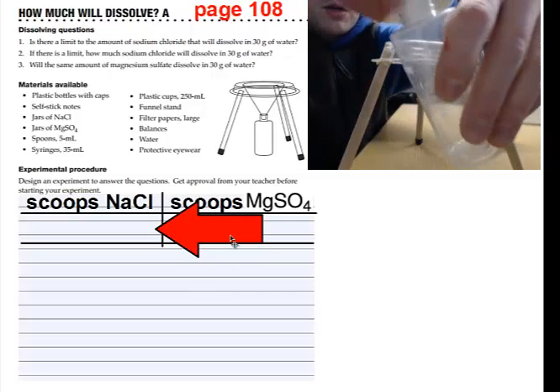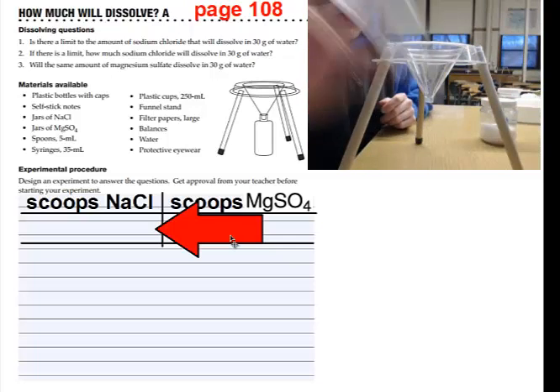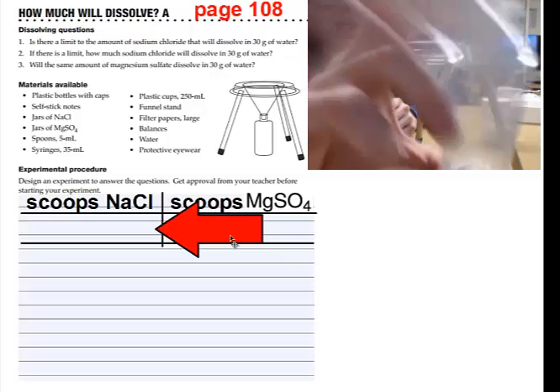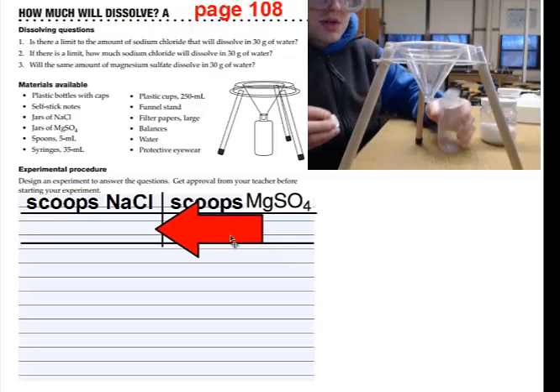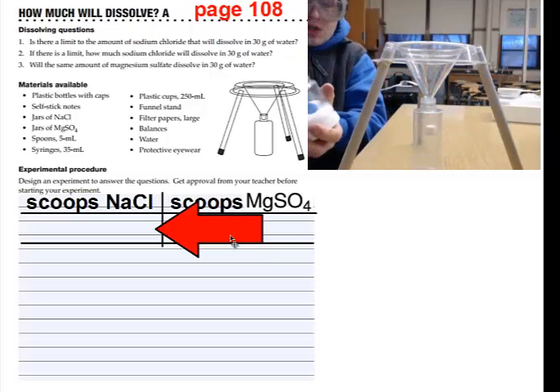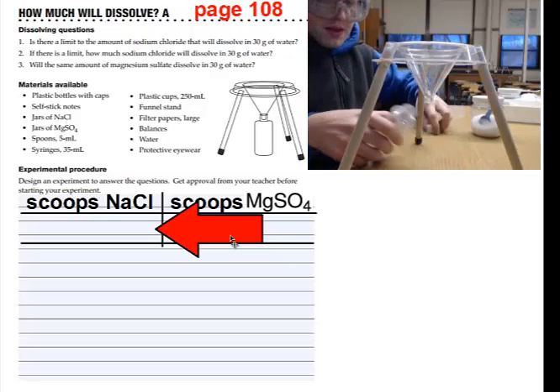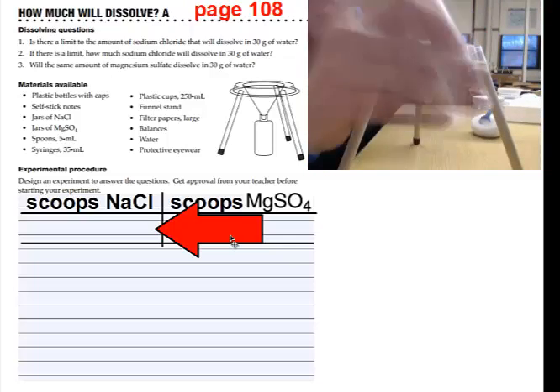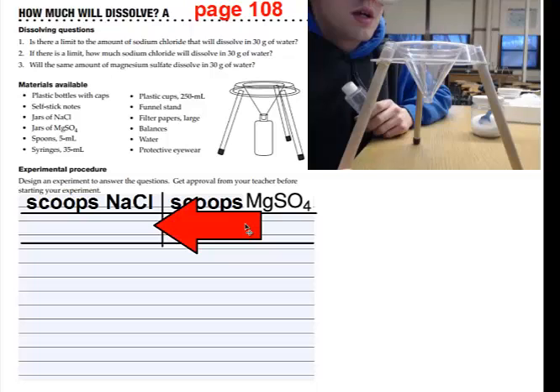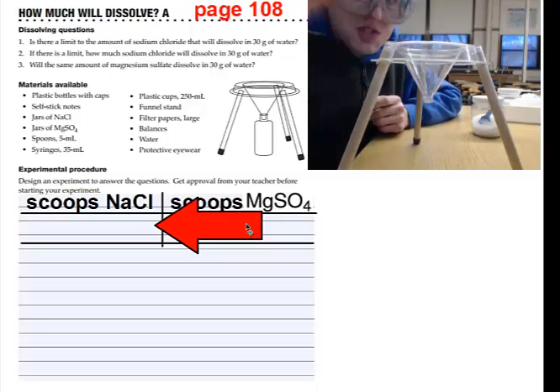Then you're going to take the bottle with 30 milliliters of water in it and 1 scoop of NaCl and shake it. And you're going to have to shake it for a while until the sodium chloride is dissolved. Once the sodium chloride is dissolved, you're going to place it back underneath the cone, and add another scoop of sodium chloride, and then once again cover the cap and shake it until it's dissolved. And keep track on your scoops of NaCl how many scoops it takes until the solution is saturated.